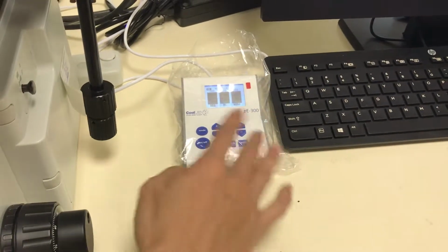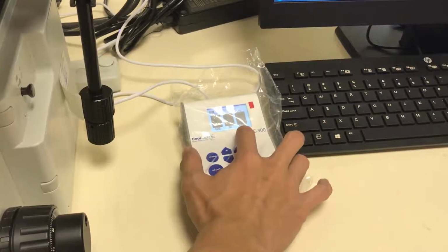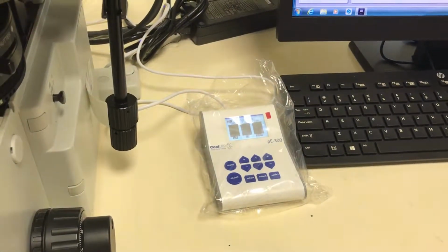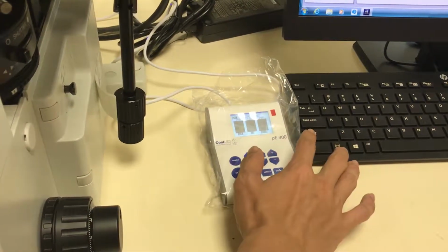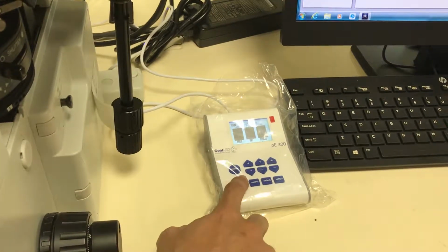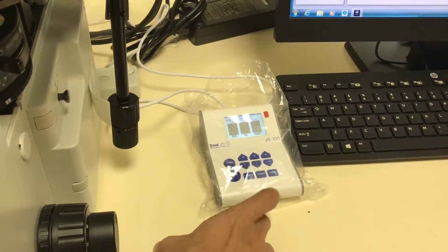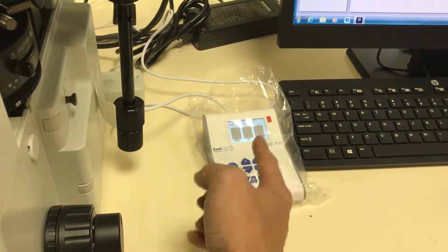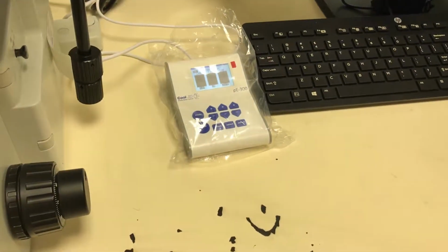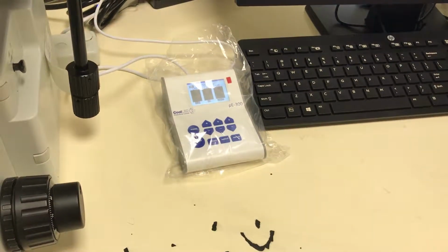Okay, there's 3 wavelength, 3 LED here. One is the UV, the other one is blue, the third one is covering from green to yellow to red. So when you turn all of these on together, you will get a white light coming out. Okay, so just on, off. And one of the advantages of using LED is that you can get instant on off. You don't have to wait. In the previous one, the mercury burner, you have to wait 30 minutes before you can turn it on again, but this is instant on off.